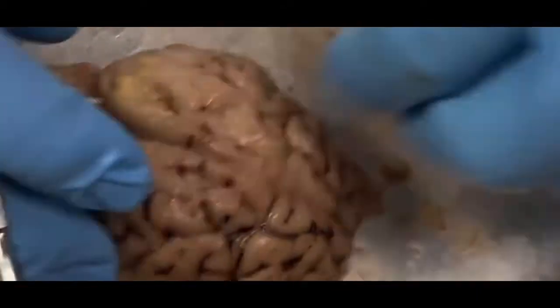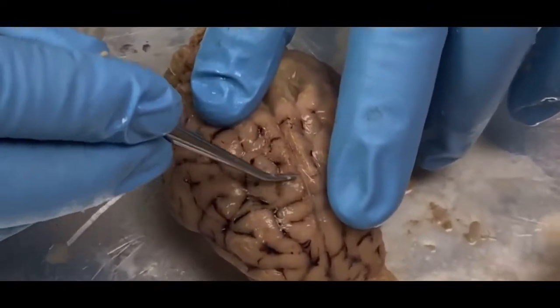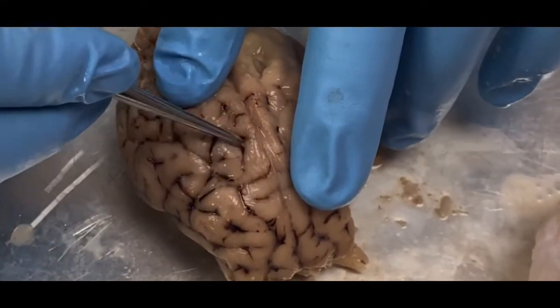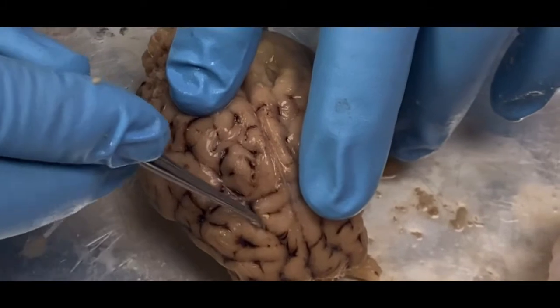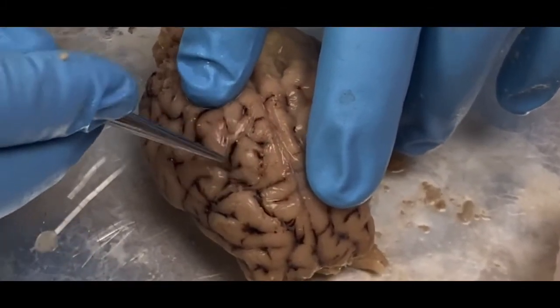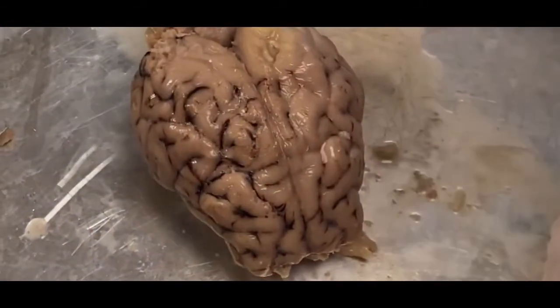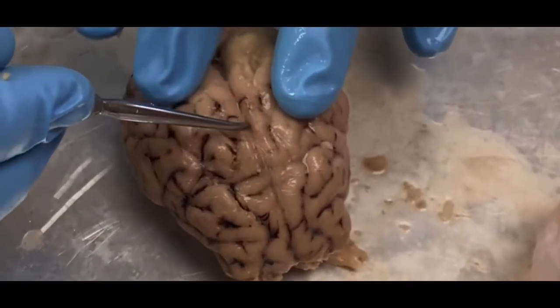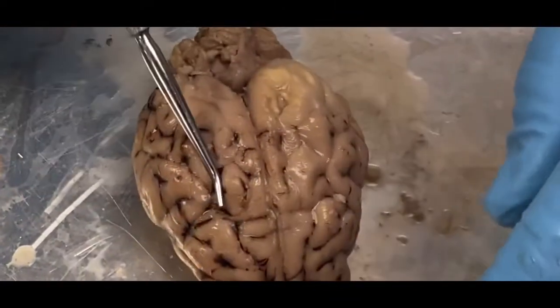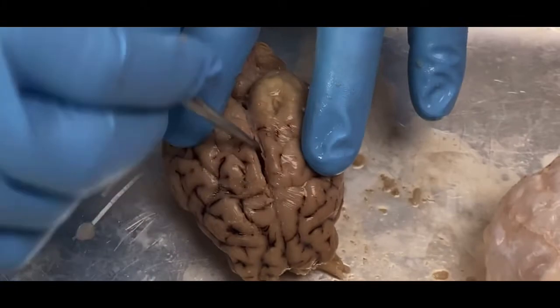If we look at the top of the brain now, some things real quick: if you notice the solid parts here, those are called gyri, that's plural. They'd be gyrus if it's singular. And then right here, these depressions are called sulci. So that's going to be the sulci, which are little depressions around the gyri. By the way, if it's singular, it's called sulcus. This here is going to be my longitudinal fissure, right? And it's going to separate my right and my left cerebral hemisphere. So again, this big part here is the cerebrum.